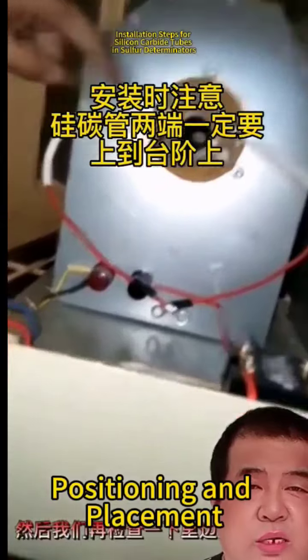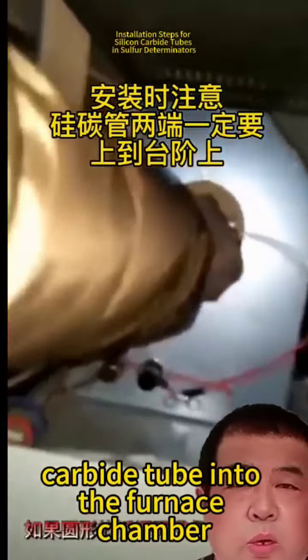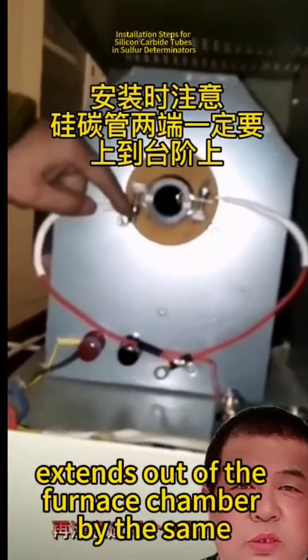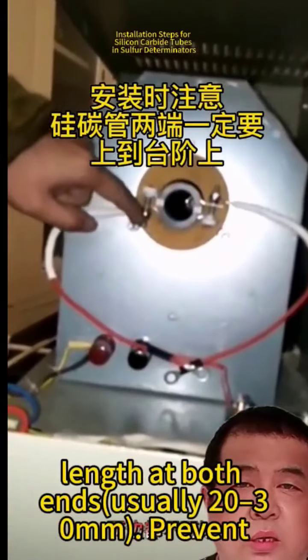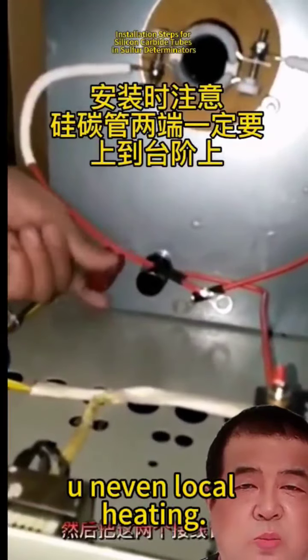Positioning and placement. Slowly insert the new silicon carbide tube into the furnace chamber, ensuring the tube is horizontally coaxial and extends out of the furnace chamber by the same length at both ends, usually 20 to 30 millimeters. Prevent tube deflection that could cause uneven local heating.